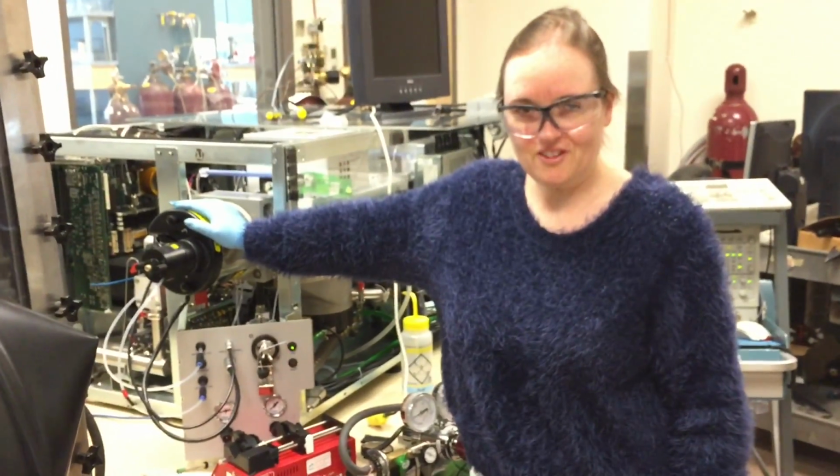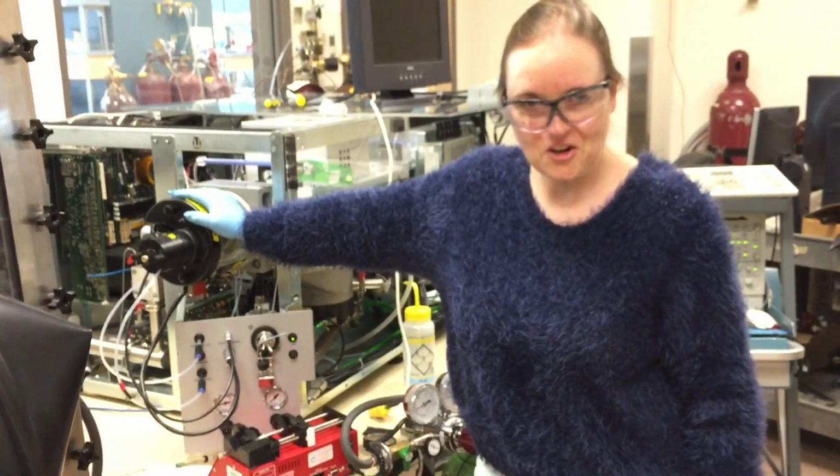Alright. And now you've changed the capillary and you're ready to restart your reaction again.